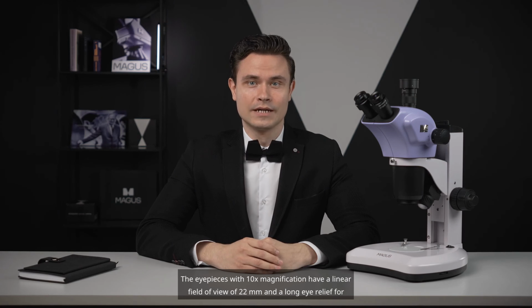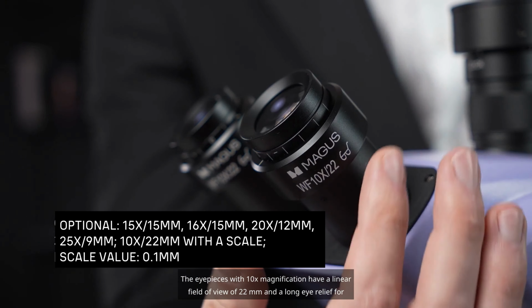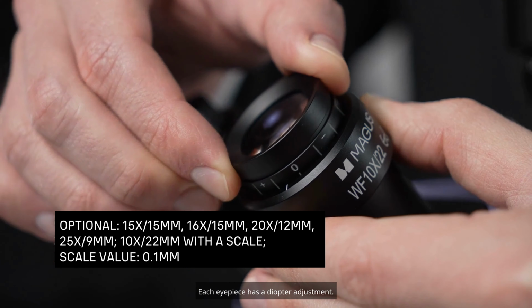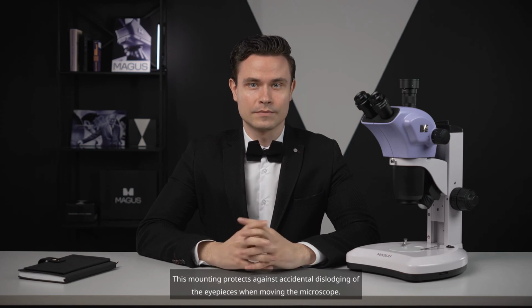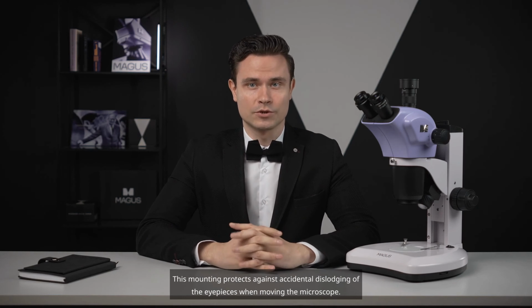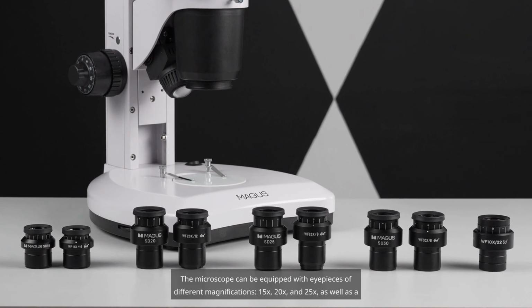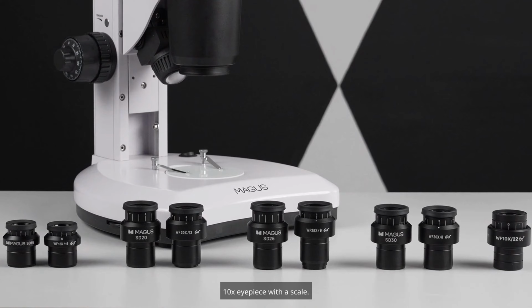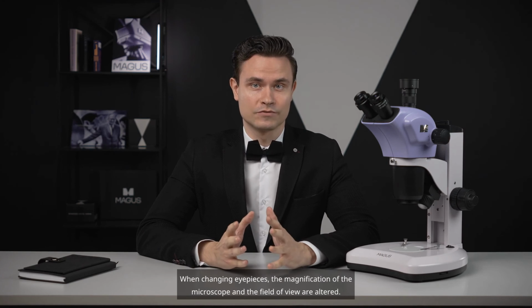The eyepieces with 10x magnification have a linear field of view of 22 mm and a long eye relief for comfortable use with glasses. Each eyepiece has a diopter adjustment. The eyepieces are securely fastened in the tubes with screws. This mounting protects against accidental dislodging of the eyepieces when moving the microscope. The microscope can be equipped with eyepieces of different magnifications, 15x, 20x, and 25x, as well as a 10x eyepiece with a scale. When changing eyepieces, the magnification of the microscope and the field of view are altered.